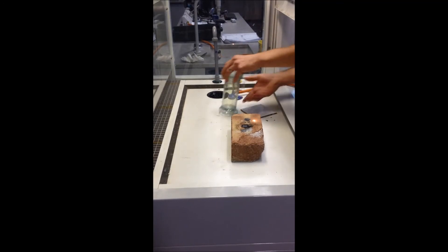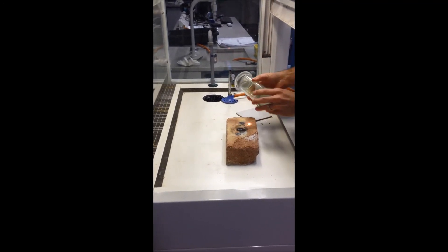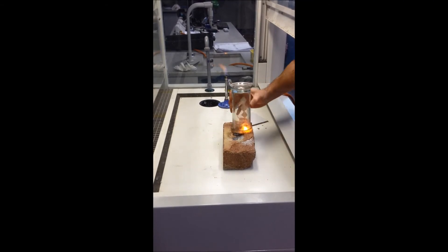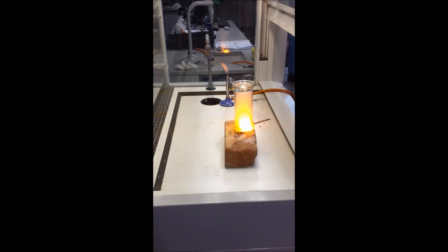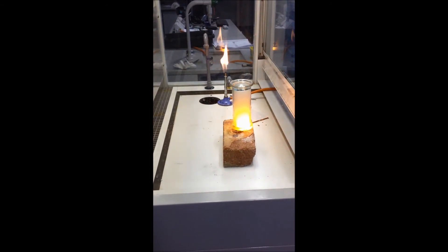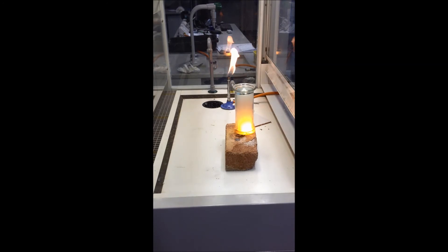So we've got it all molten, we're going to add our chlorine. You can see it glowing, you can see the reaction.